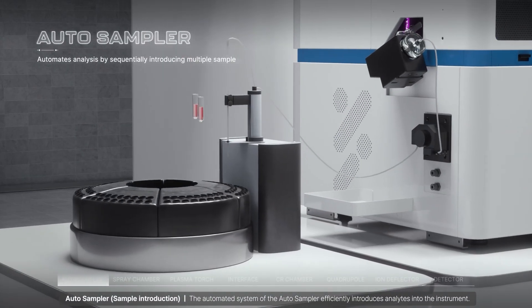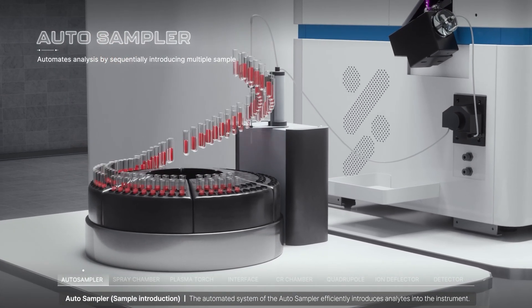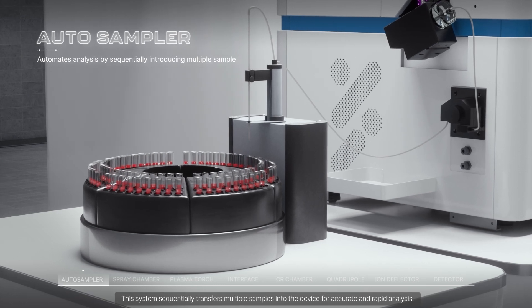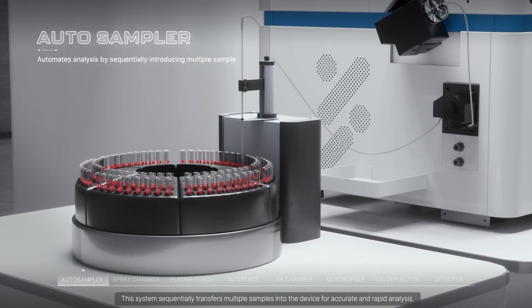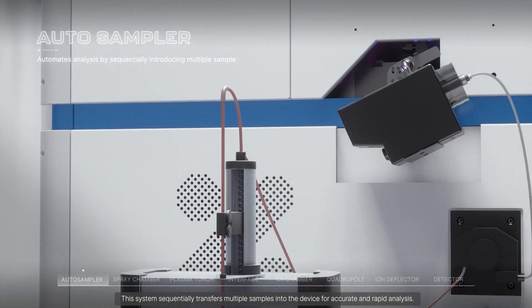The automated system of the auto sampler efficiently introduces analytes into the instrument. This system sequentially transfers multiple samples into the device for accurate and rapid analysis.